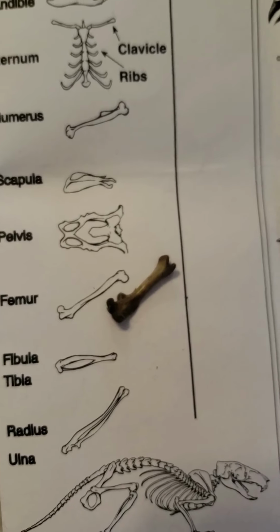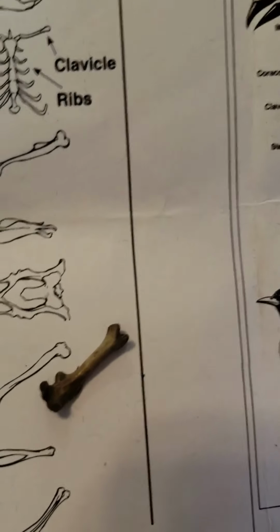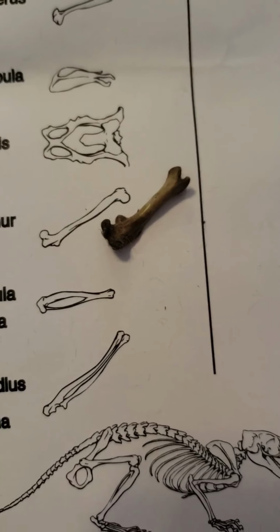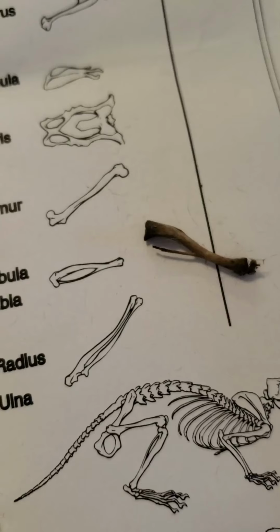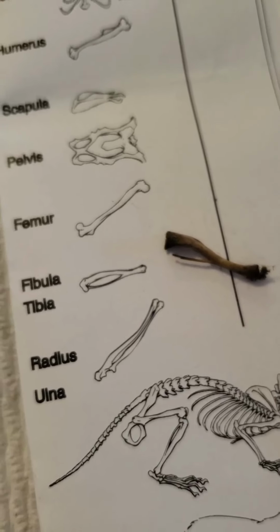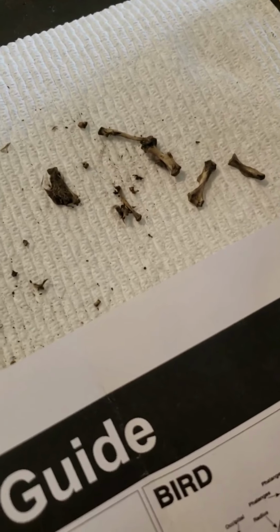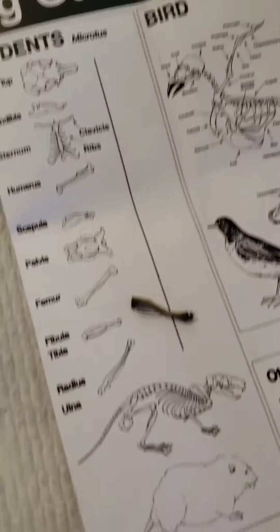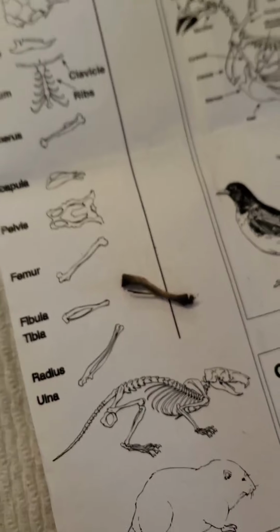All right, so it looks like here we found the femur. So that's pretty cool. That's pretty intact. It's one of the stronger bones, or might even be the strongest bone. And so it's not very fragile looking. It's pretty thick. And then we also found the fibula and the tibia in this one. And all the other bones, they're kind of tiny and hard to decipher. So I'm just going to go ahead and put those to the side and maybe do one more owl pellet dissection for you all so that you can watch it one more time and maybe we'll find something cool.